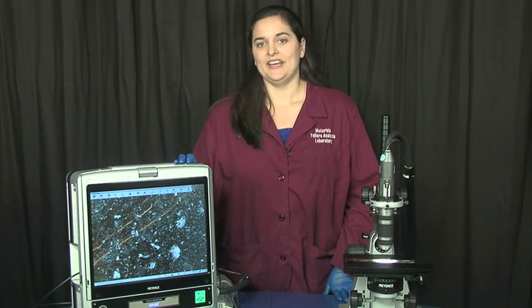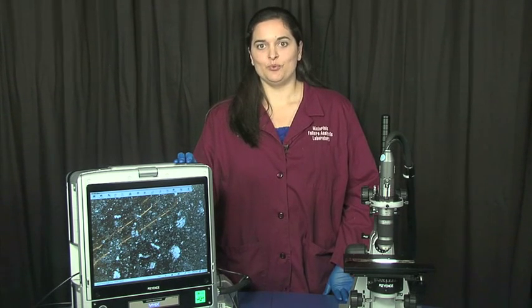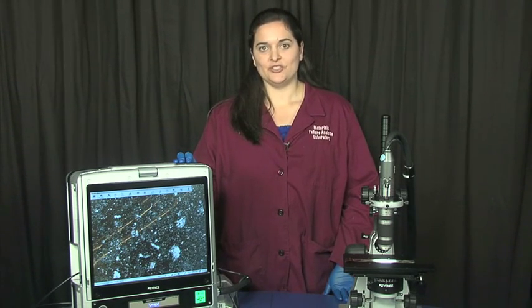This is a digital microscope, and I'm going to show you how we use this instrument to investigate the debris that was brought back from the International Space Station.